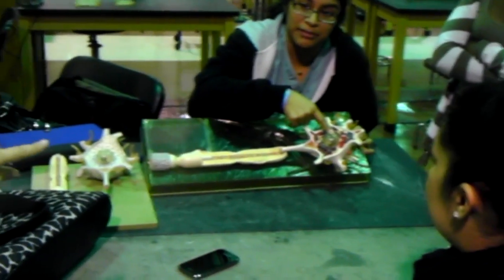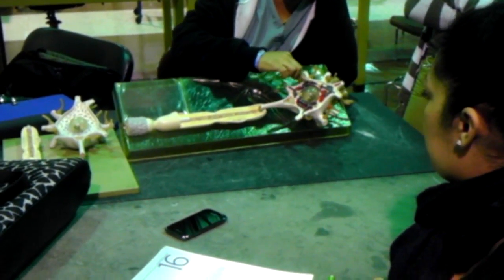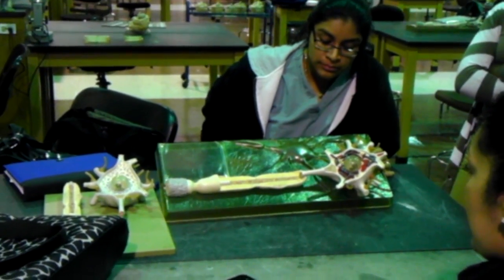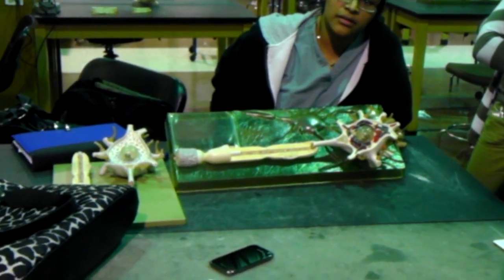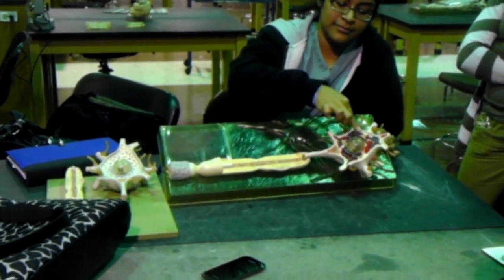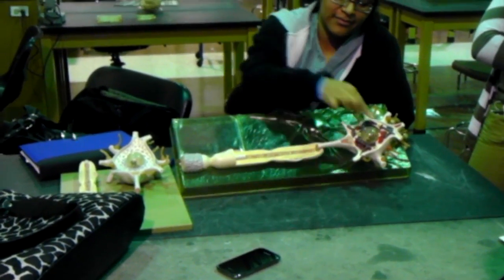What are the gray structures? This is the nucleus, yes. What are the gray structures, guys? Can you guess? Very good. This is the rough endoplasmic reticulum, but Sejal, in the neuron it has a specific name. What's the name of it? Thank you, Nissl bodies. So those gray structures are Nissl bodies, right? The red ones are Golgi apparatus.